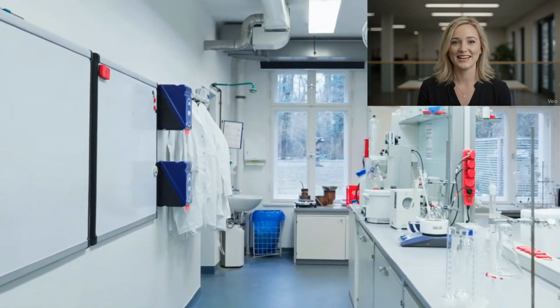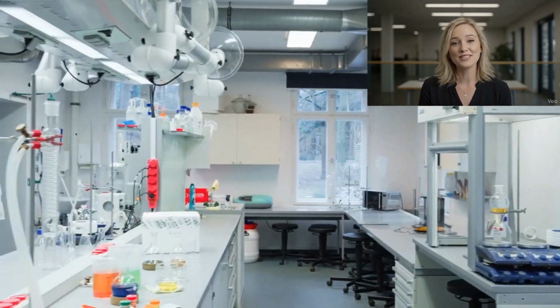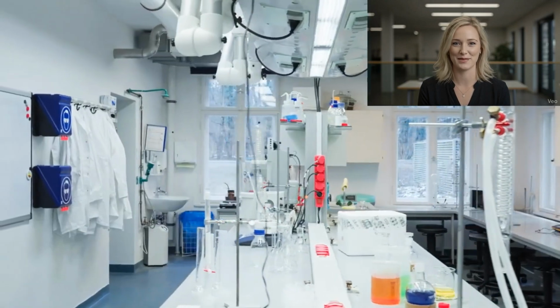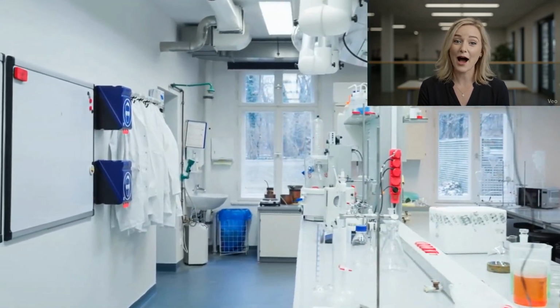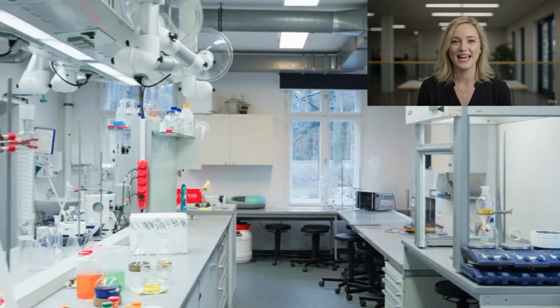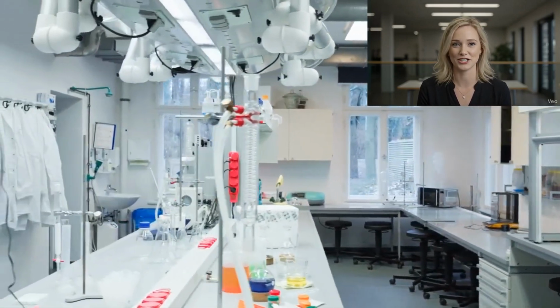Paper chromatography is the technique for separating dissolved chemical substances by taking advantage of their different rates of migration across sheets of paper. It is an inexpensive but powerful analytical tool that requires very small quantities of material. It can be used to separate a variety of mixtures.